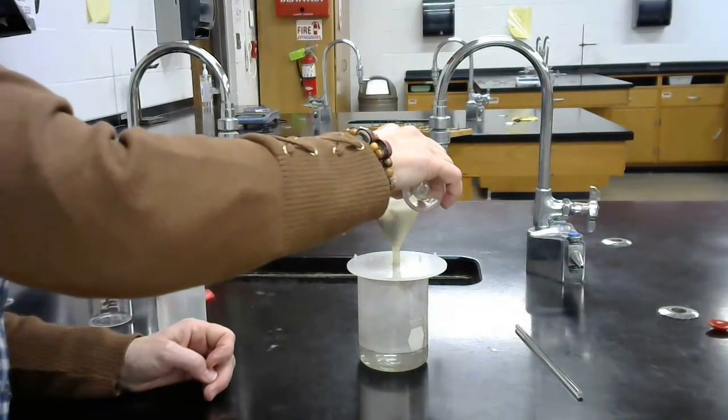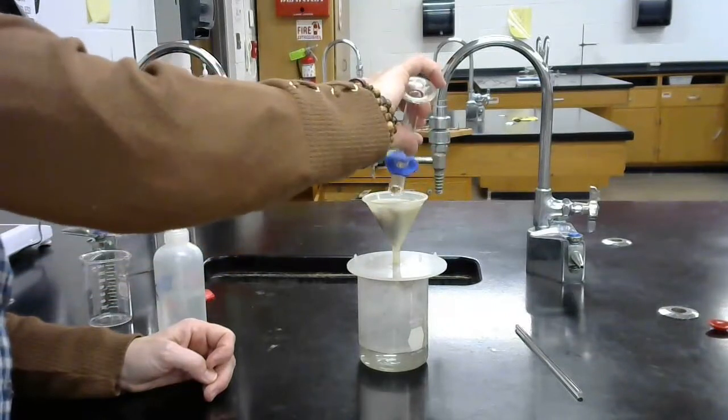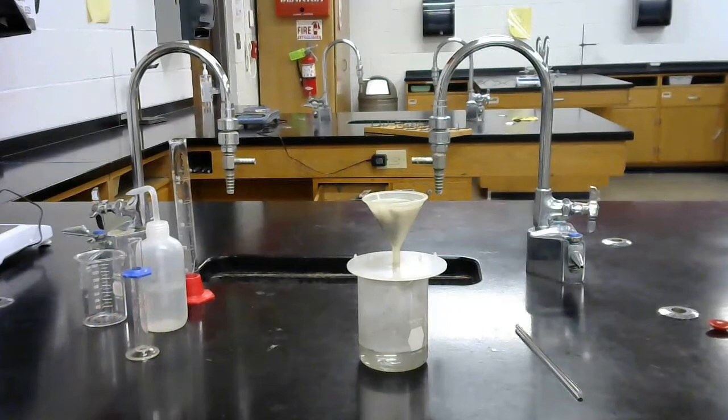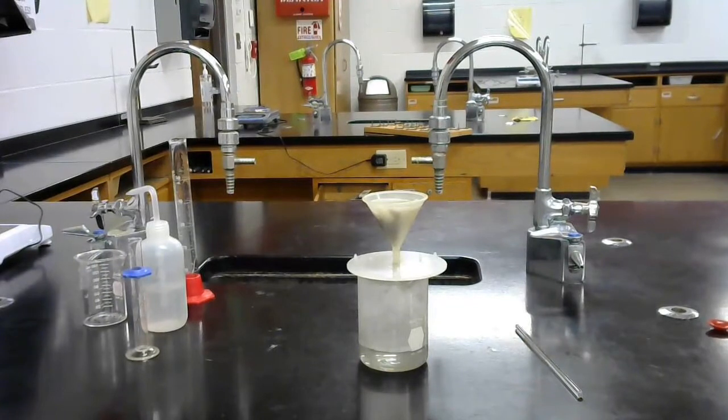So I'm going to add my hydrochloric acid on here just to make sure we don't have any impurities in there. Let that finish filtering. And we are completely done except for the last massing and getting that to dry in the oven.